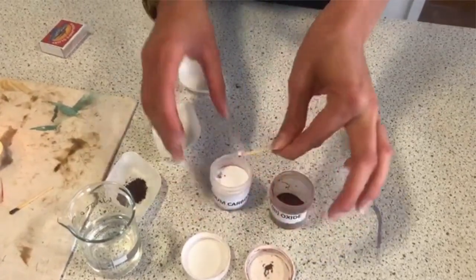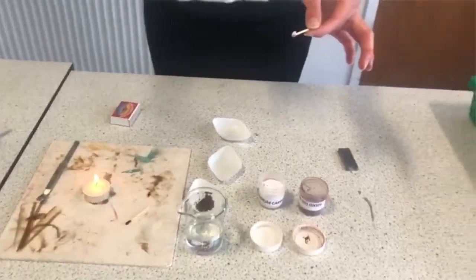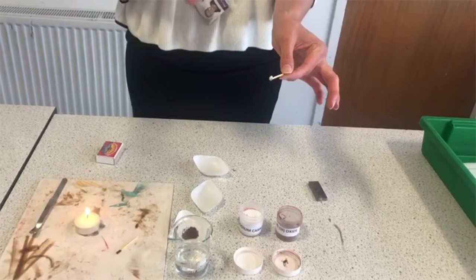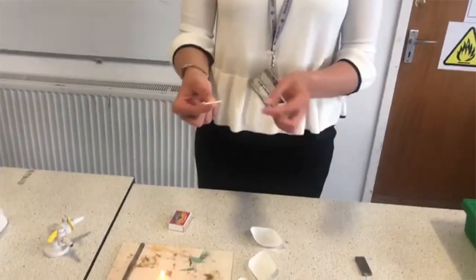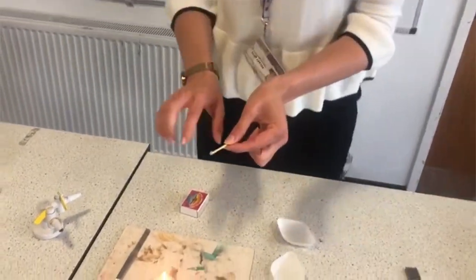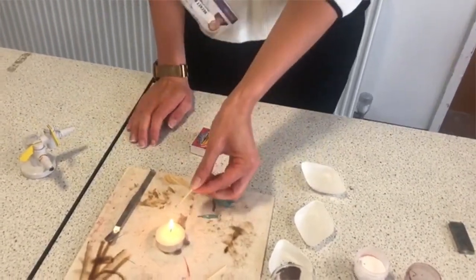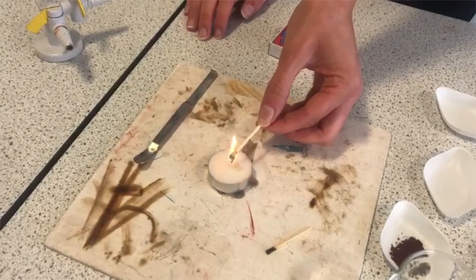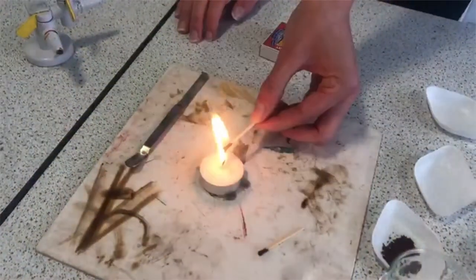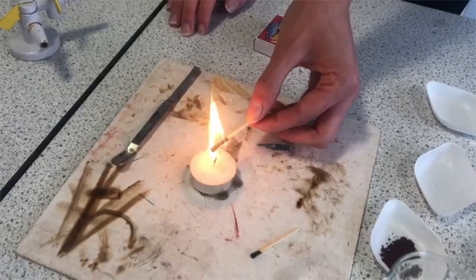What I'm going to do is put that into my flame. What that's going to lead to is a chemical reaction, which will allow me to extract my iron from my iron oxide — that is the aim. I've got my two chemicals and I need some heat in order to make this reaction happen. So I'm going to put my match into my candle flame to make sure I've got some heat. We've got our chemical reaction taking place here.